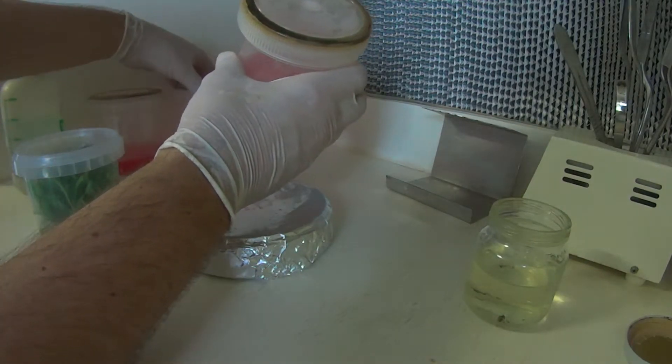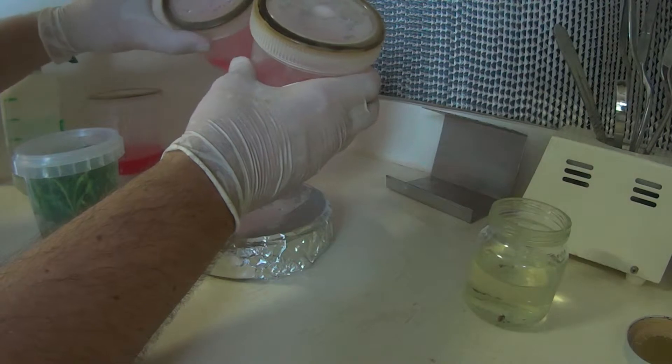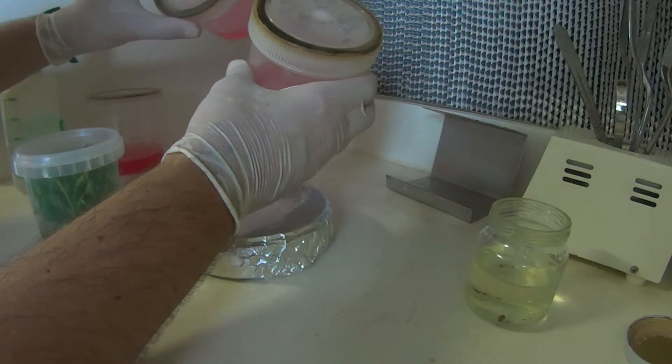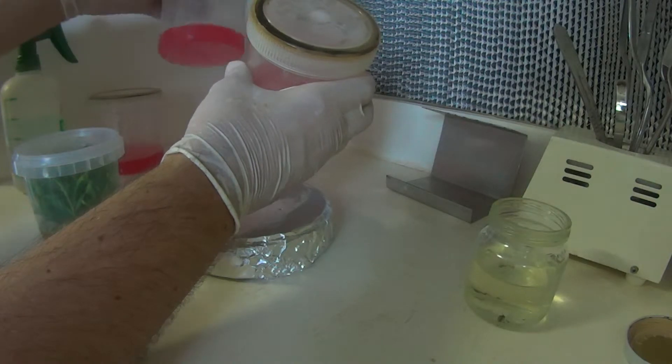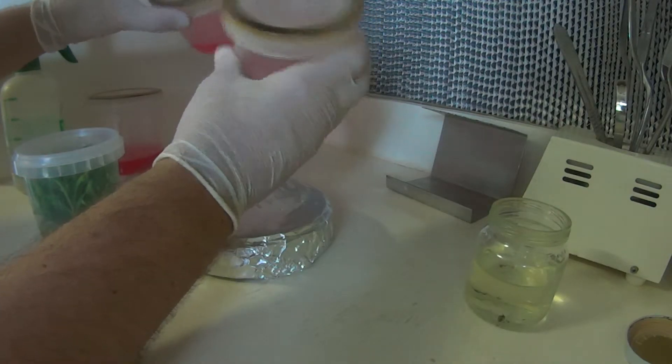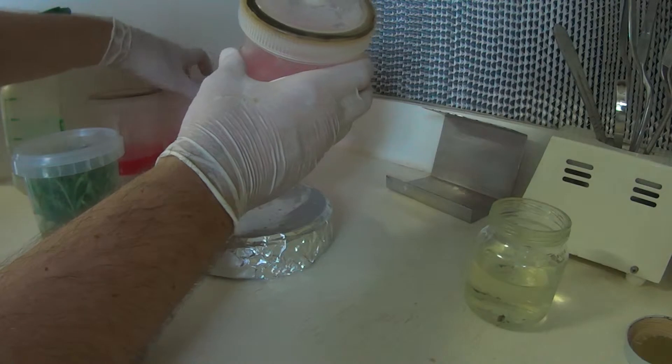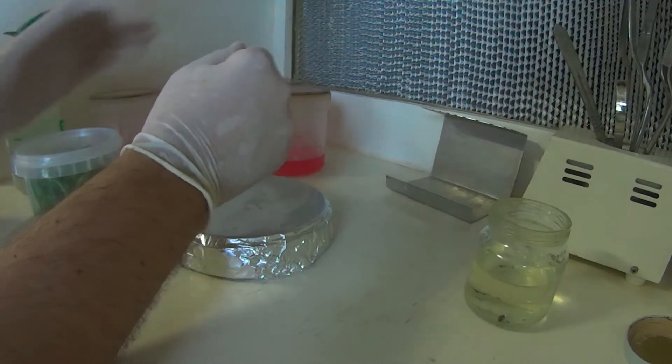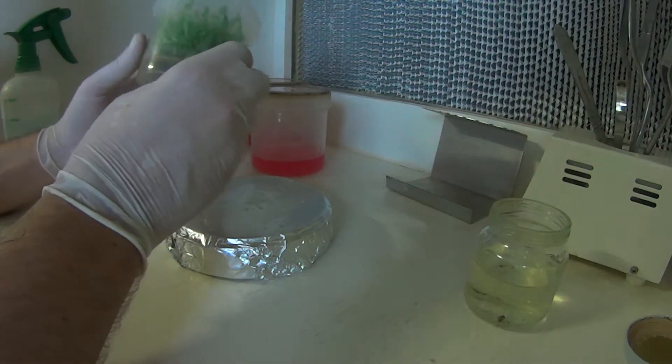They can be quite expensive if you're using a large number of them. This is I believe a polypropylene polymer type vent spot. They all work pretty much the same, just stop contamination from entering and allow gas exchange inside the container.